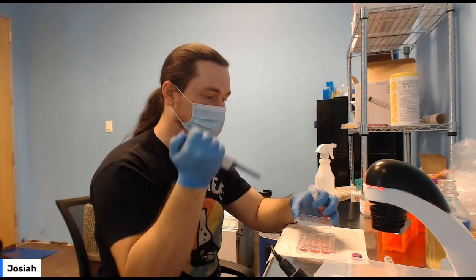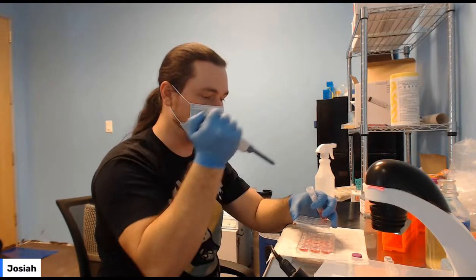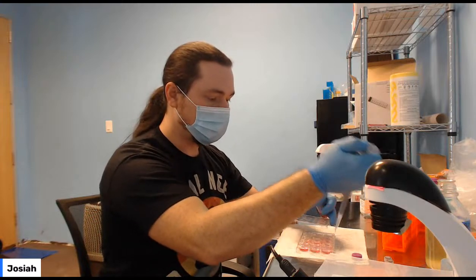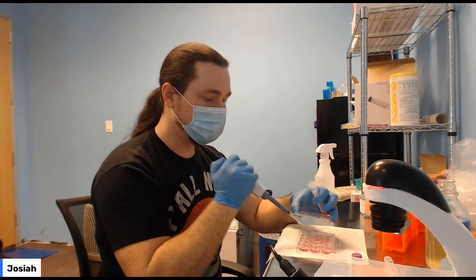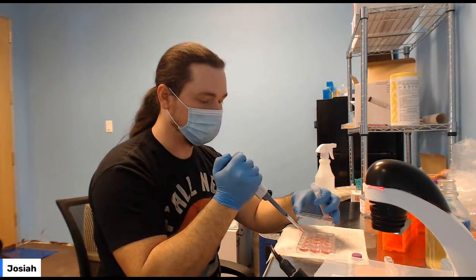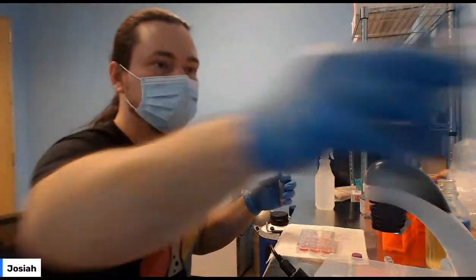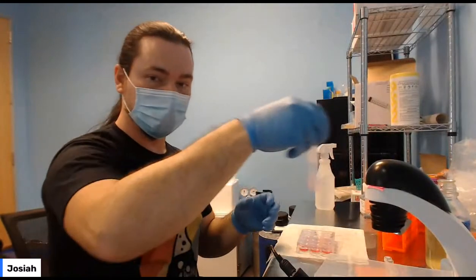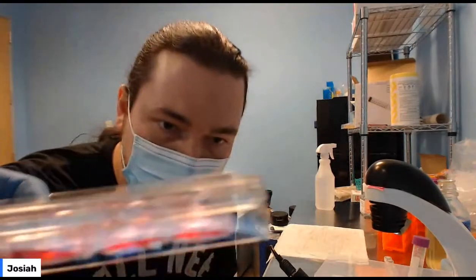So then I'm going to jump forward with the plate I already made, and I'll do what you're going to do in a couple of days. What you want to do is watch these plates, watch these wells, and make sure that they continue to grow and attach. And you might get some wells that are contaminated or that dry out or that generally aren't happy. And that's okay. You don't need all the wells. So the well should look like that.